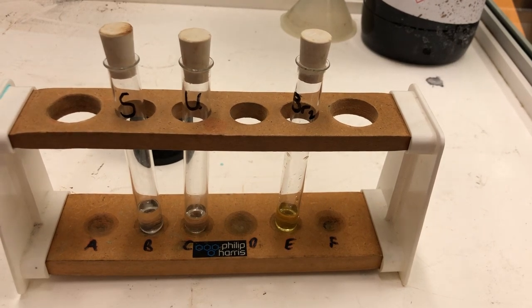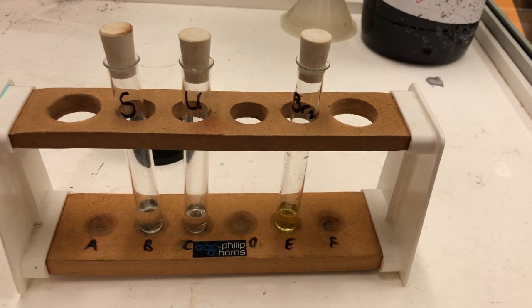In this experiment we will react one liquid which is saturated and one which is unsaturated, both with bromine water. Bromine is the diatomic Br2, a member of the group 7 elements, the halogens. The halogens are all reactive molecules, they're all diatomics, and they undergo what's called an addition reaction. Their key reaction is addition reactions.